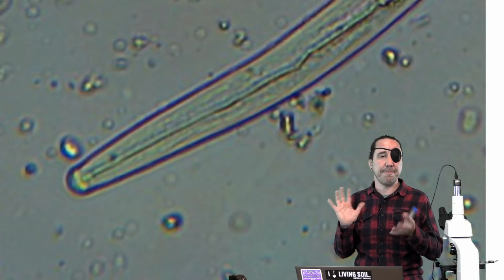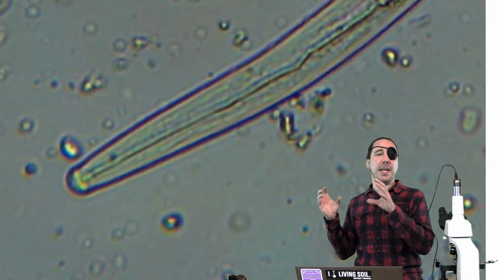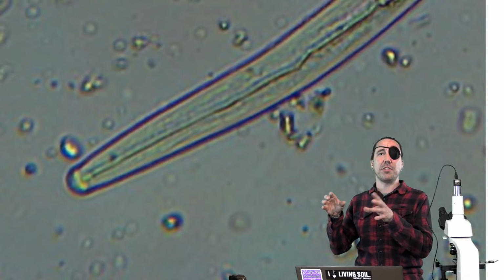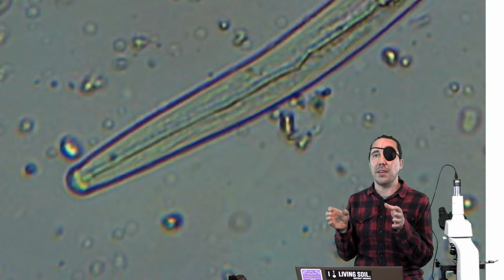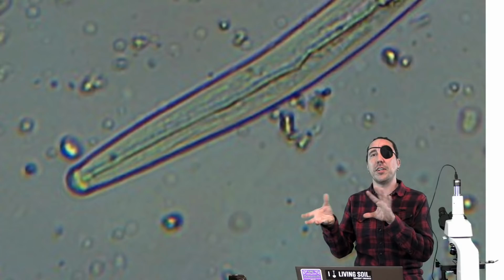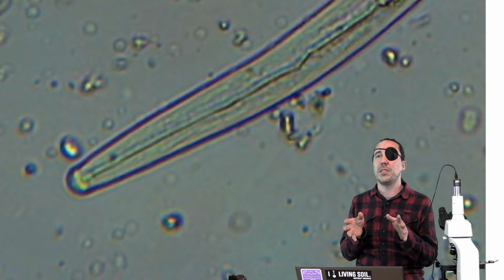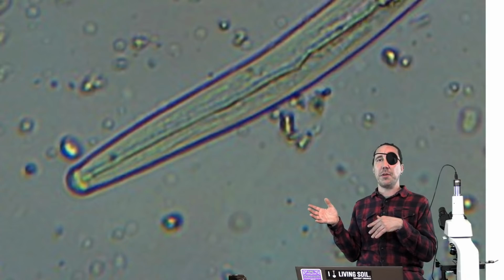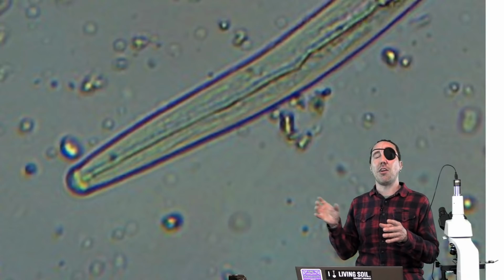But yeah, so I was just going to mention too with sizes, it's hard for me to mention sizes with this because everything's microscopic and you may not be used to this, but once you get used to looking at things, you're going to see some smaller nematodes and you're going to see various sizes of the nematodes. So usually bacterial feeding nematodes, they're just eating bacteria, they're going to be smaller in size, where if you've got predatory nematodes, which are eating other nematodes and larger things, they're going to be larger in size.